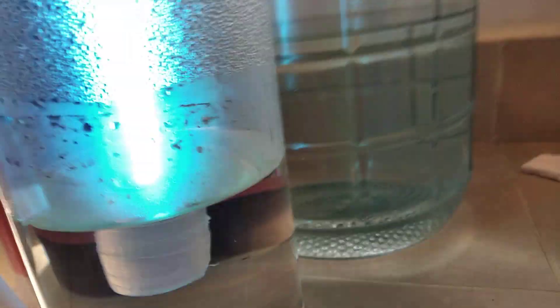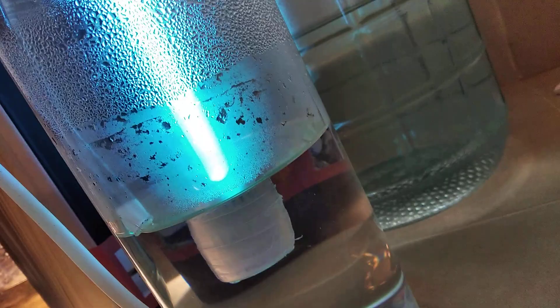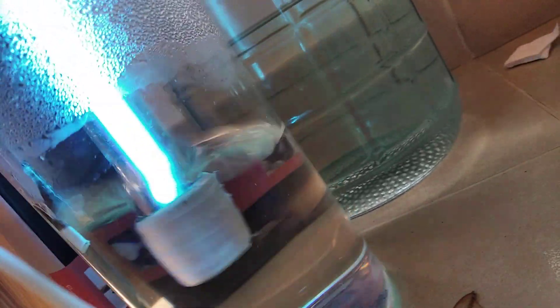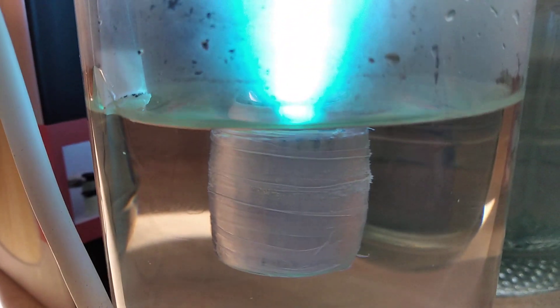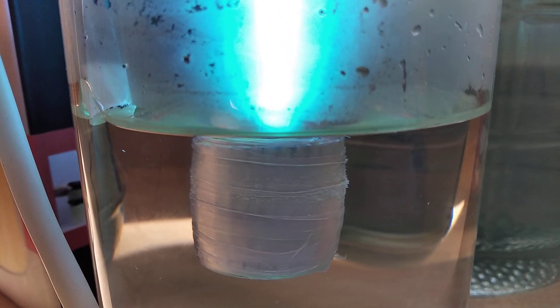Over here is where HCL is generated. So I've already tested this reaction countless times, it's fairly safe. I've never blown up once even with high amounts of flow rates. So when I run this you can see that there's like mist coming out of this.